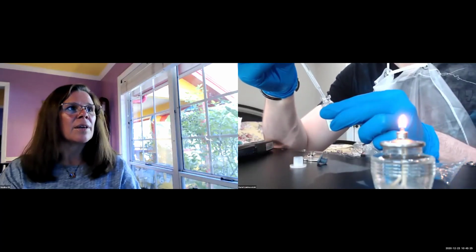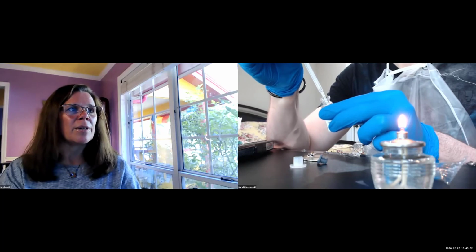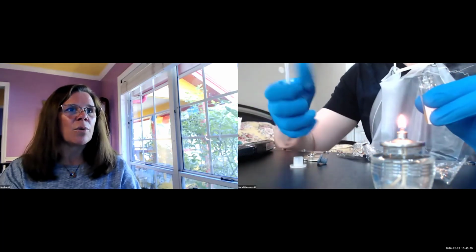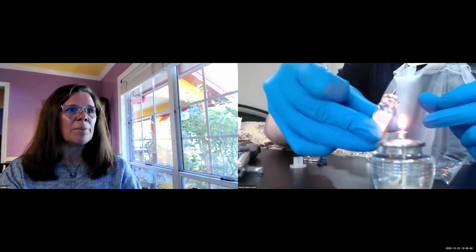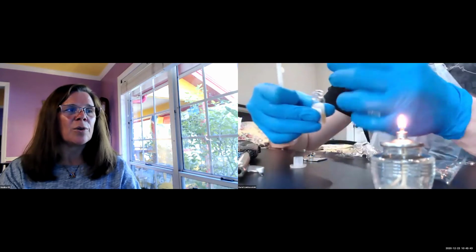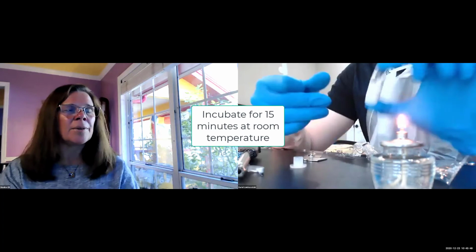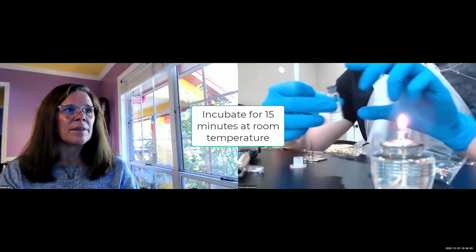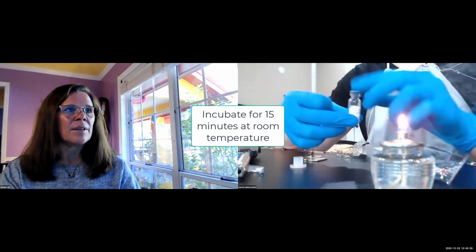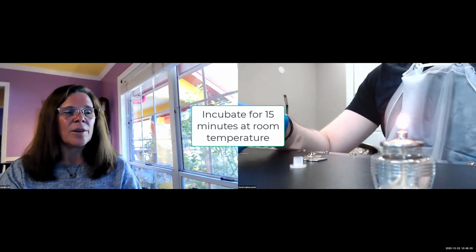Then put your culture in here, in your liquid media, just squeezing the pipette. And then flame the top of the tube again. So every time you open or close anything, you always flame it before and after. And then put the lid back on. In an ideal world, you don't put the lid down, but it should be okay. Then swirl it around a little bit, and we'll let it sit for about 15 minutes. You can dispose of your transfer pipette.